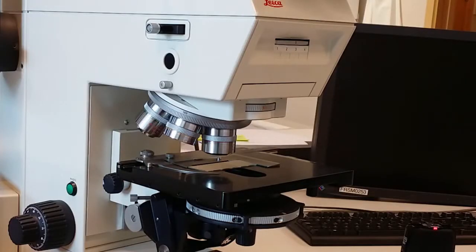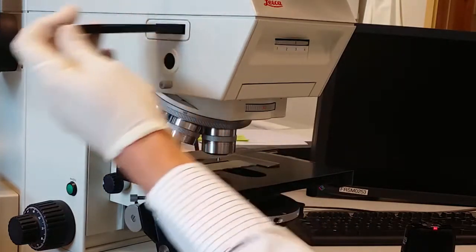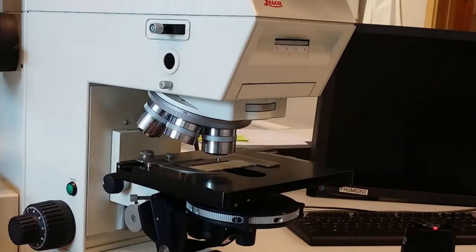The purpose of that layer is, when you print with regular ink, it's supposed to be transported down to the inner layer and thereby get some kind of protection to physical touch and moisture. So let's see what happens when I put in the lambda plate now. Okay, in order to make lambda contrast, we change the polarizer on this left side and put the lambda plate upwards. That will make a colorful effect on the sample.